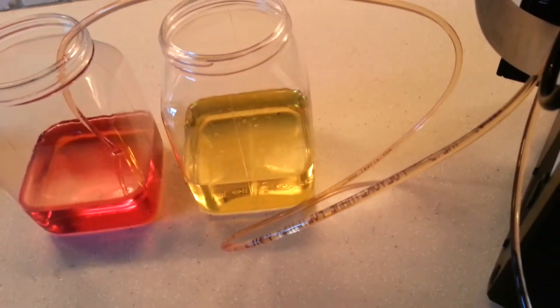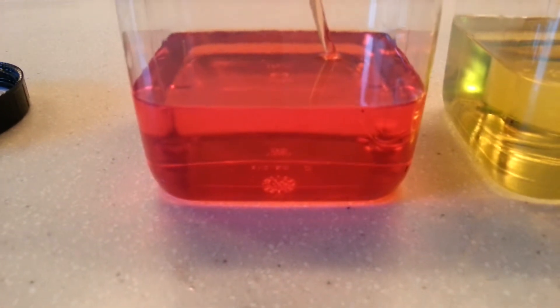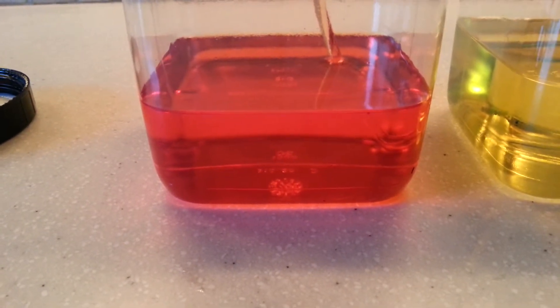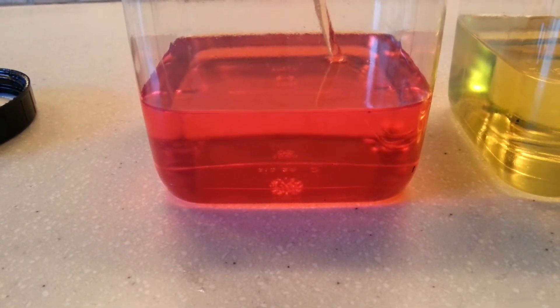So it's nearly finished. This red fuel — the red diesel — is from a client that we polished, and it was in a very, very poor state. We did take readings on site, which turned out to be very good.